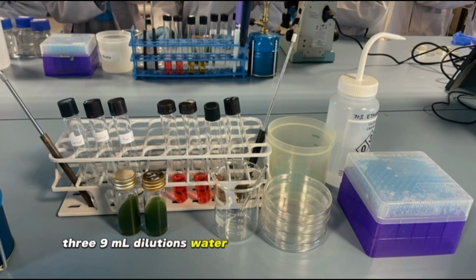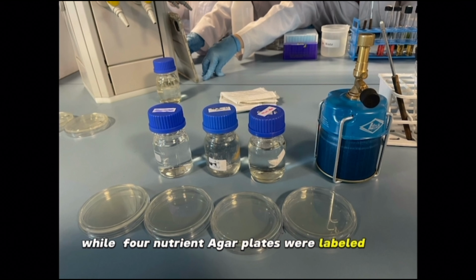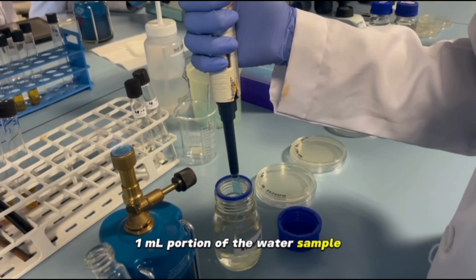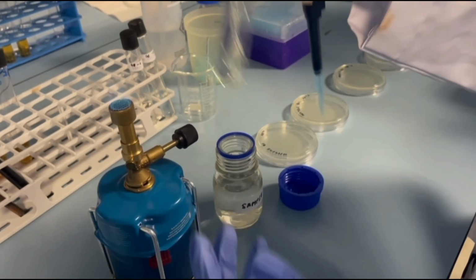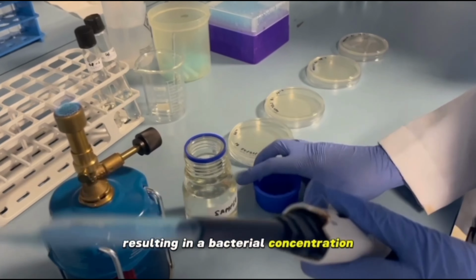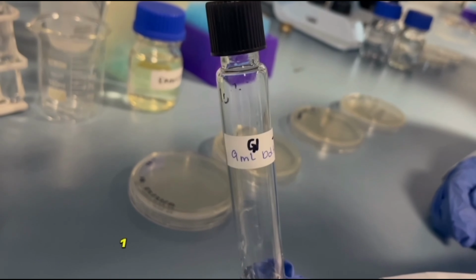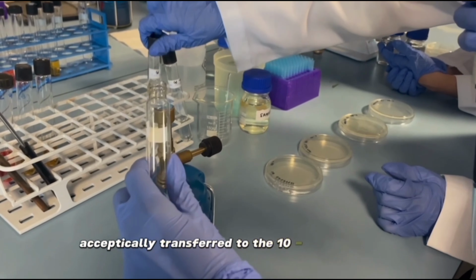9 ml dilution water blanks were labeled as 10^-1, 10^-2, and 10^-3, while 4 nutrient agar plates were labeled 10^-1 through 10^-4. A 1 ml portion of the water sample was aseptically pipetted into the 10^-1 dilution tube. The 10^-1 dilution tube was thoroughly mixed by vortexing or vigorous shaking, resulting in a bacterial concentration 1/10 of the original sample.